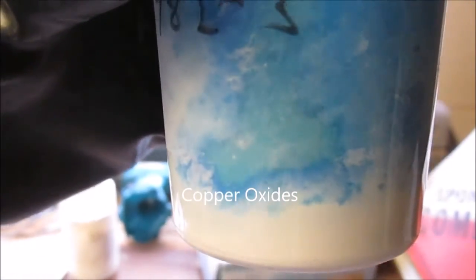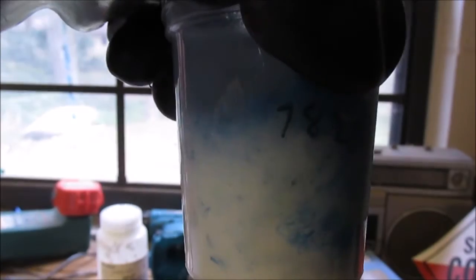The alabaster crystals forming in there, the gypsum, or calcium sulfate, to be more precise, definitely contrasts and doesn't mix well with the copper hydroxide. But it gives it a very beautiful color. You can also see the greener shades of other copper oxides forming in there. The calcium sulfate may also be producing greener shades from impurities. But it's definitely one of my more favorite reactions. It's the mixing of the blue and the white. It's very royal looking, almost like a blue marble.